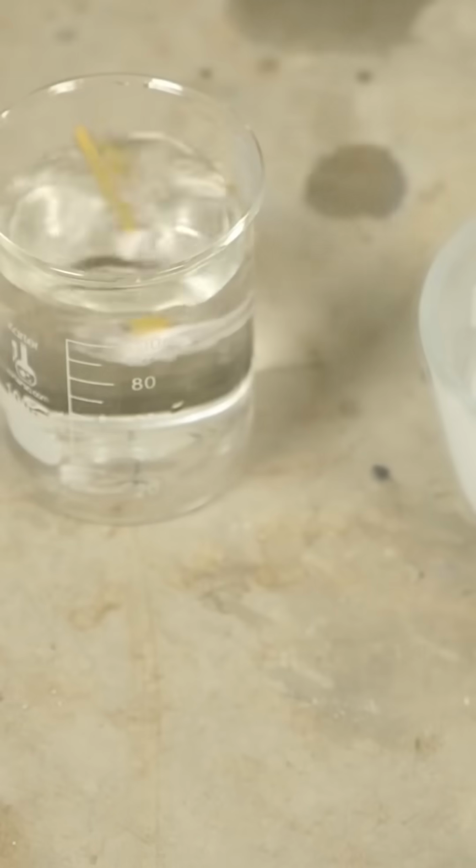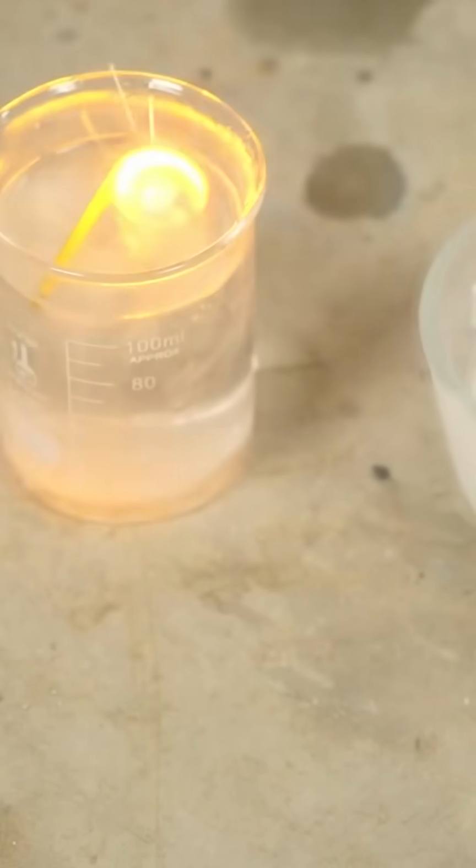But let's see what happens when I put this really cold sodium in warm water. There it finally went.